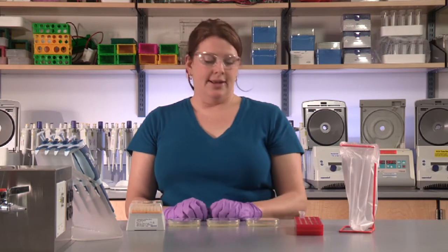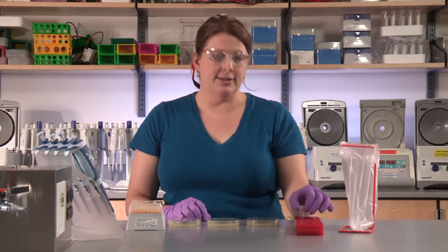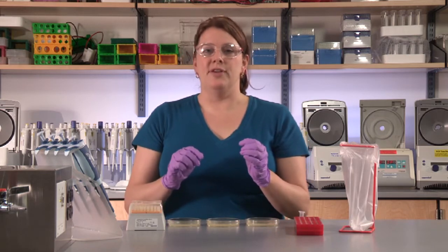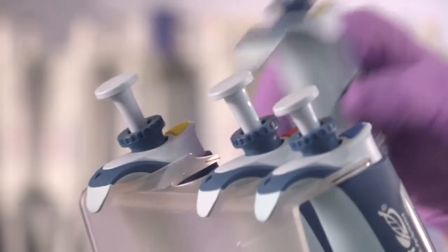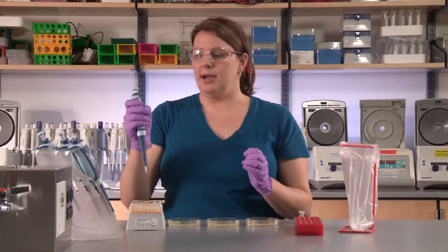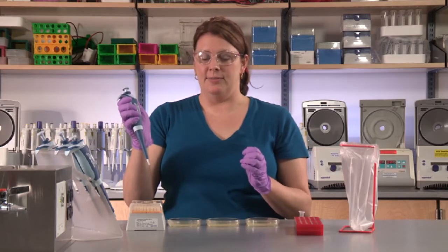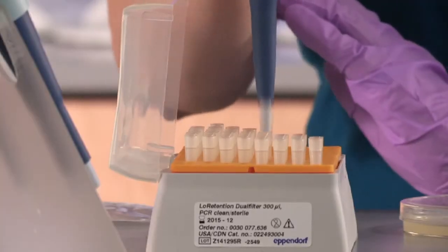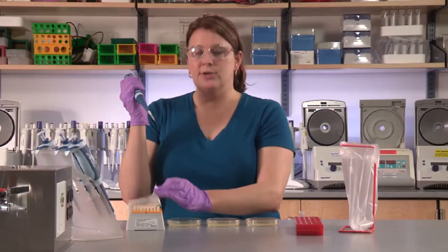To begin the plating, pick up P- cells first. You're going to be dispensing 50 microliters of these cells onto two of the plates. Pick up a pipetter that's been set to 50 microliters. Put a tip firmly on the top and close the lid.